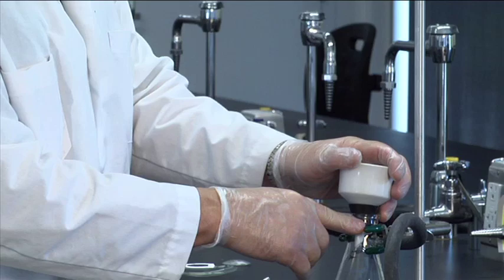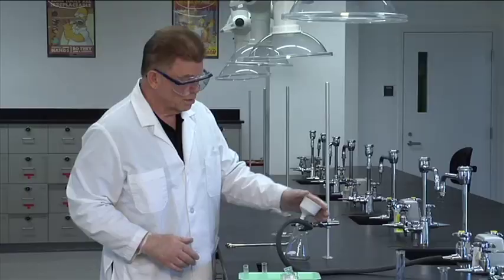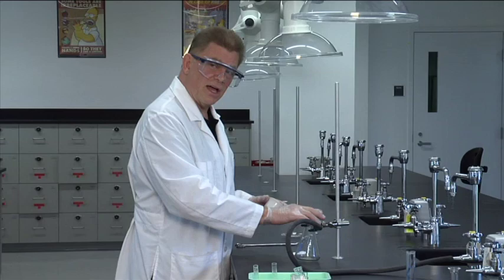If you try this experiment without the rubber thing, you got no seal. You have no vacuum. It doesn't work. Dr. Davidson, my stuff's not filtering. Yeah, you have no vacuum. Use the rubber thing.